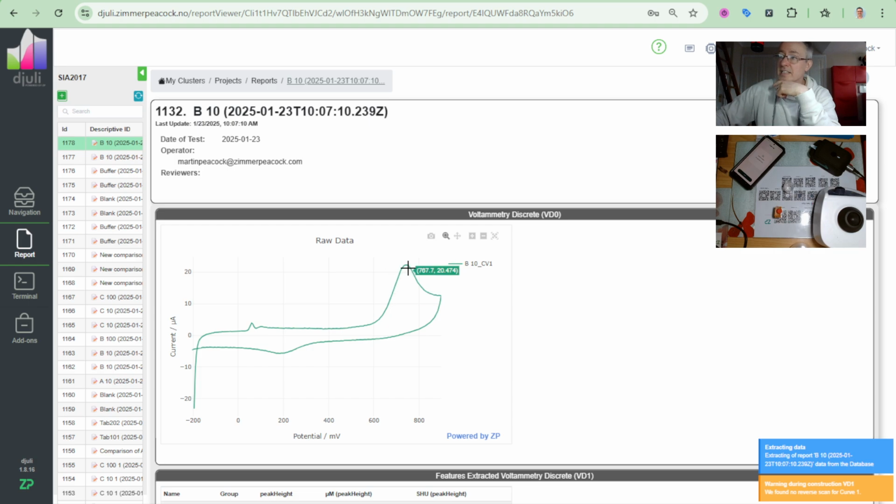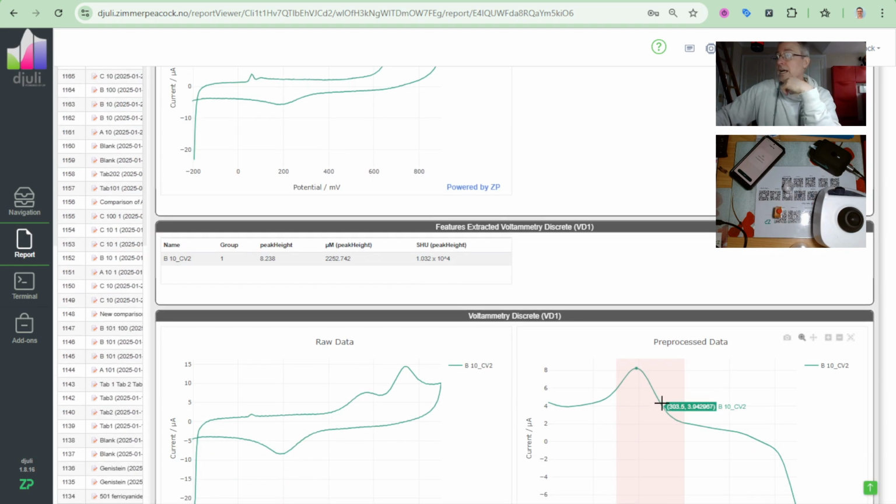And we've got an intense peak here. Now their peak was actually flatlined, but we've got an intense peak here. And actually I noticed that peak there was about 8 and theirs was about 10. So we're in a kind of similar region as them.